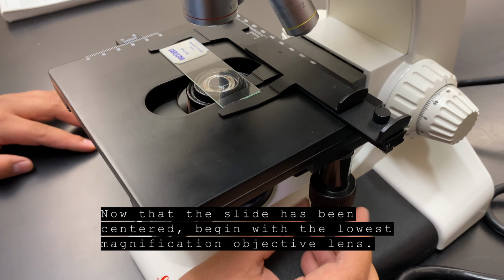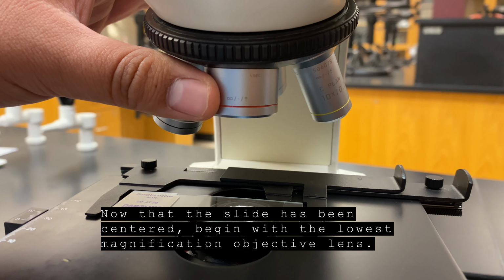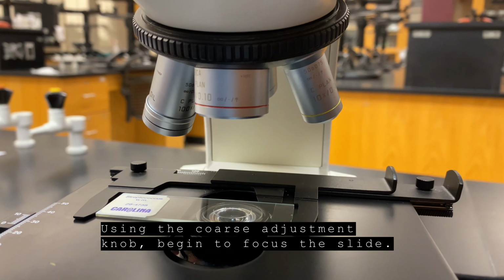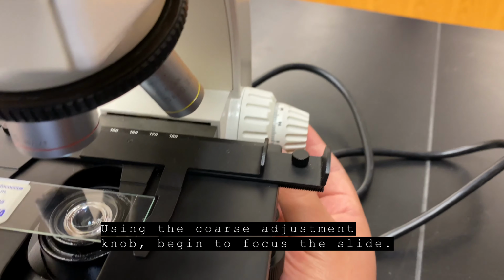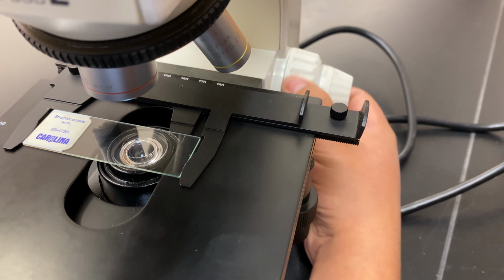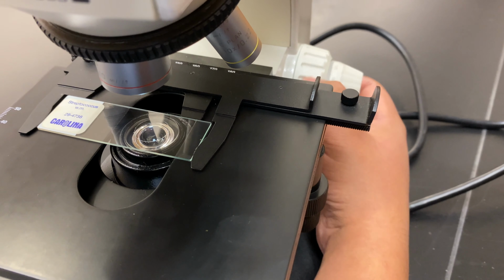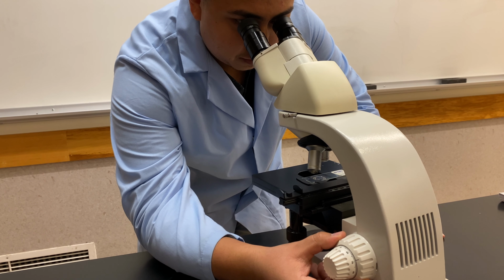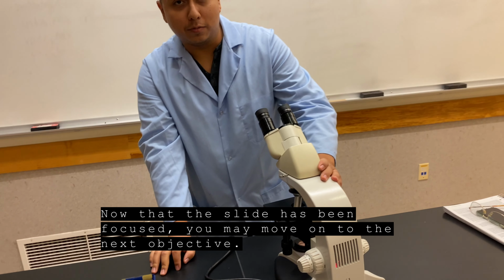Now that the slide has been centered, begin with the lowest magnification objective lens. Using the coarse adjustment knob, begin to focus the slide. Now that the slide has been focused, you may move on to the next objective.